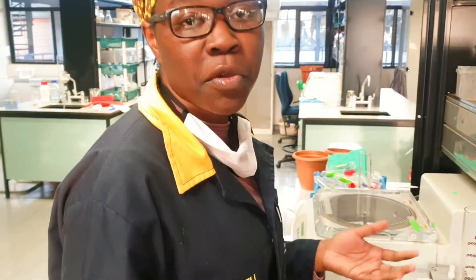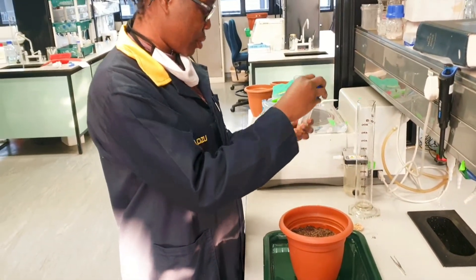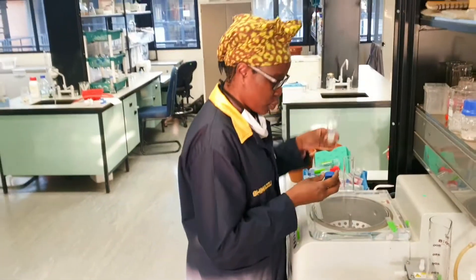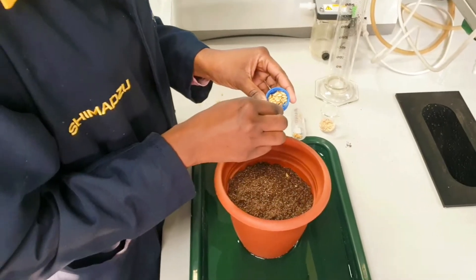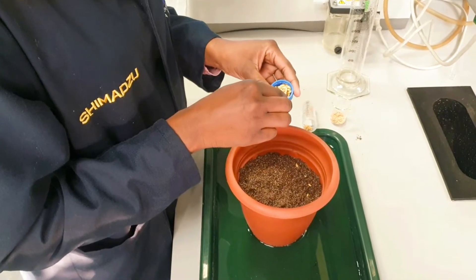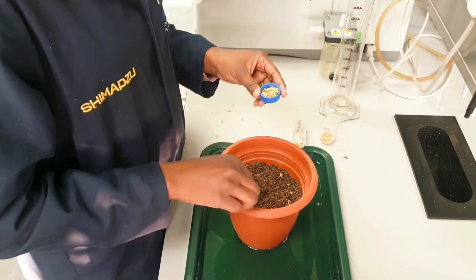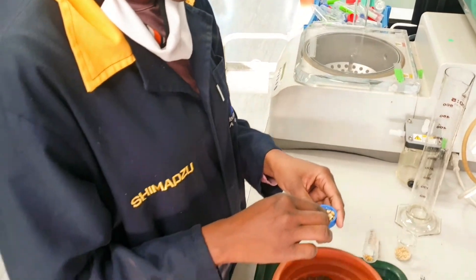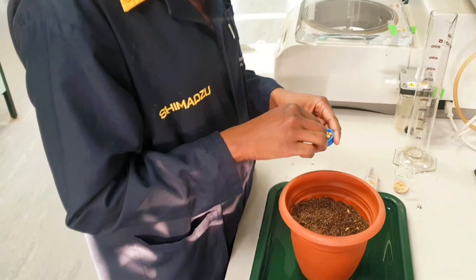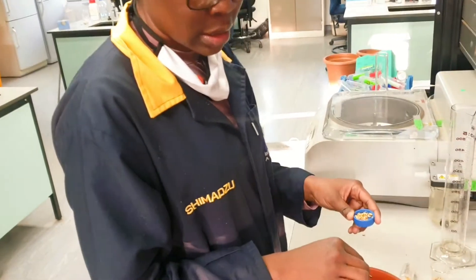The reason I'm using autoclave water is because the cultivars I'm working with are very sensitive and I don't want any contamination. To further avoid contamination, before soaking I also wash the seeds with 70% ethanol for five minutes, and after that I rinse them and soak them in distilled autoclave water.